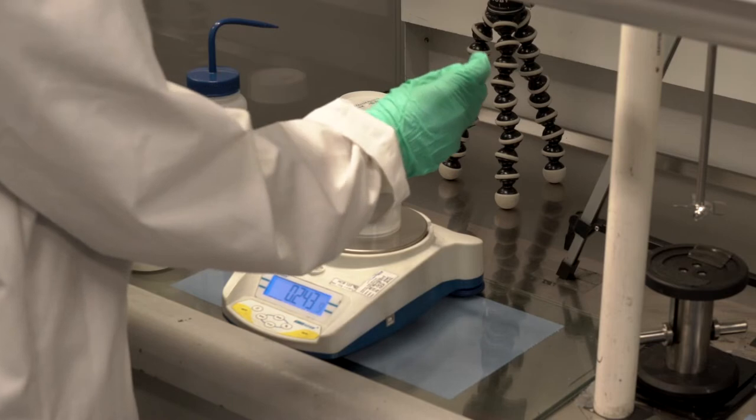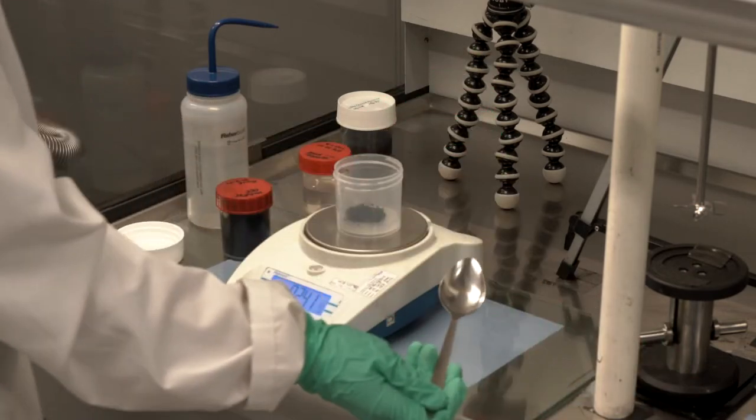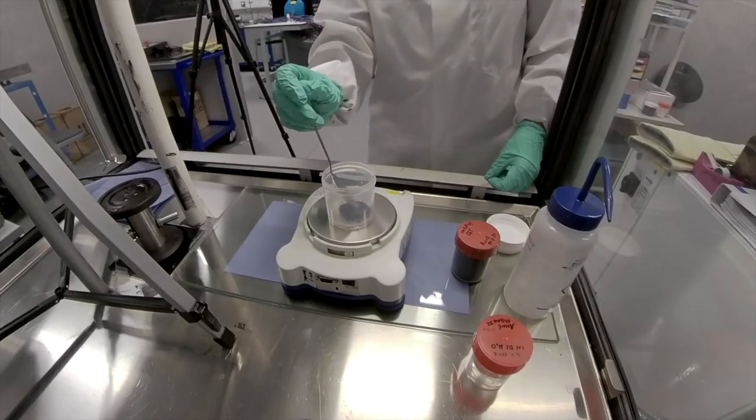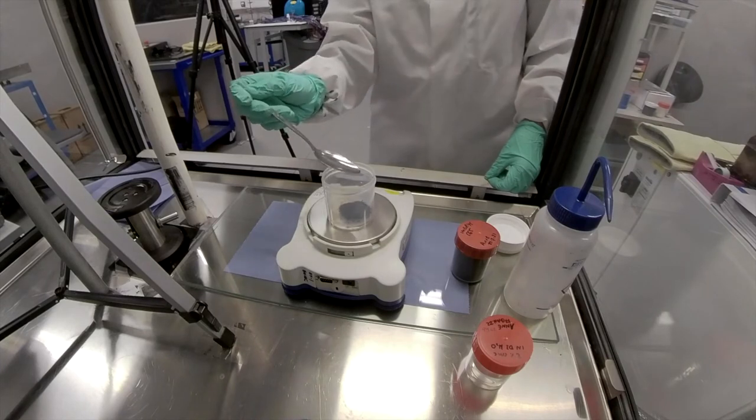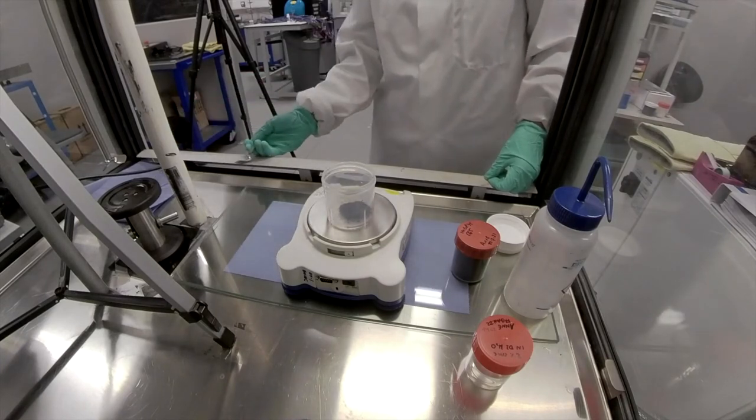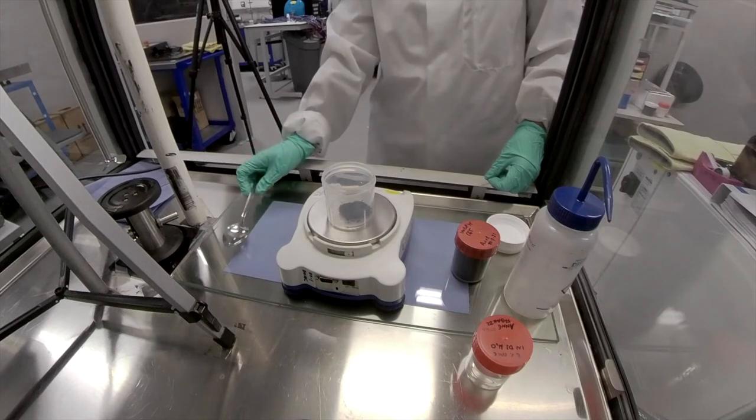Because it's floating on the top of my solution, I have a little bit of opportunity to scoop the dry material off the top if I feel I've gone over my target weight.